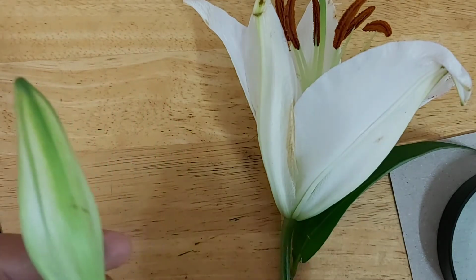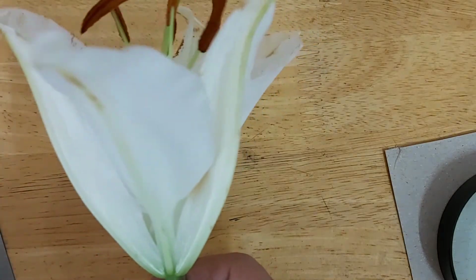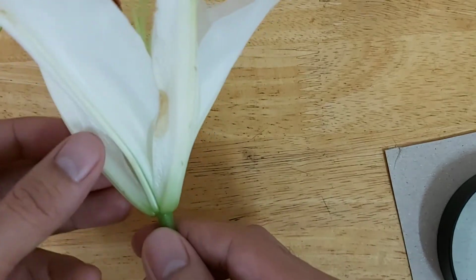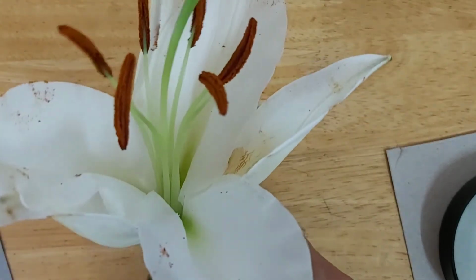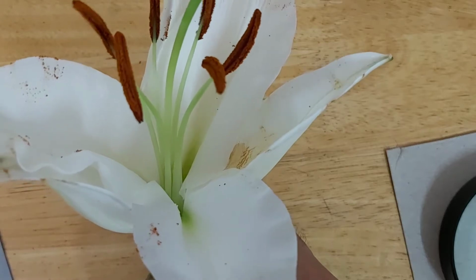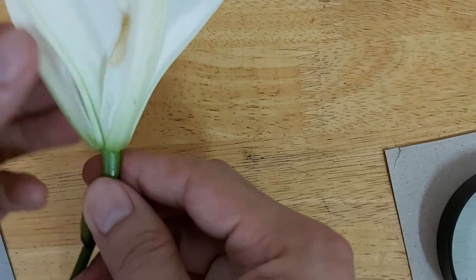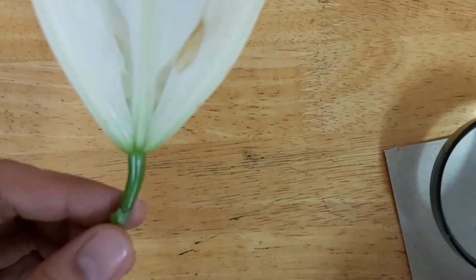Therefore, if the flower is already open, like this one, where are the sepals? The sepals will be the first 3 at the bottom of the flower. There is not much difference between the sepals and petals of this flower. The sepals are adapted to look like petals in order to have additional features that will attract the insects. Now let's remove the sepals. We are going to remove the first 3, those at the bottom of the flower.